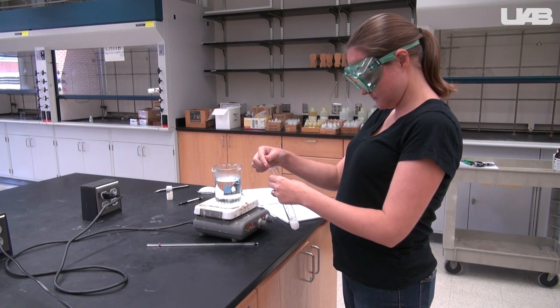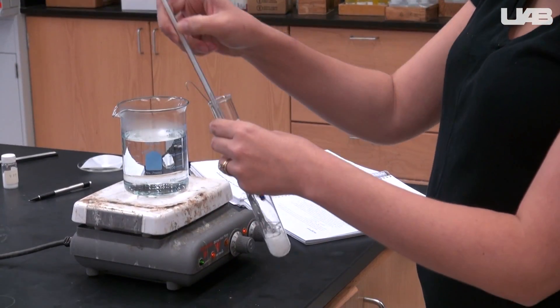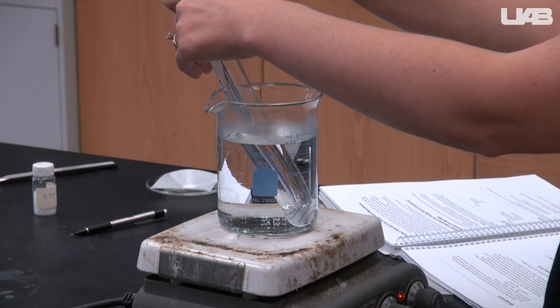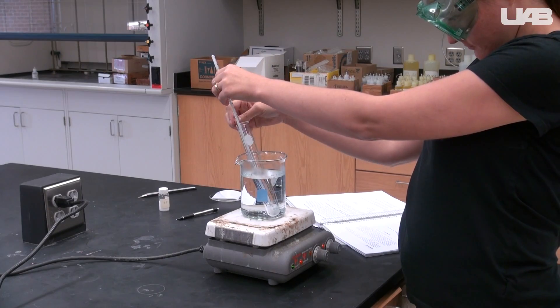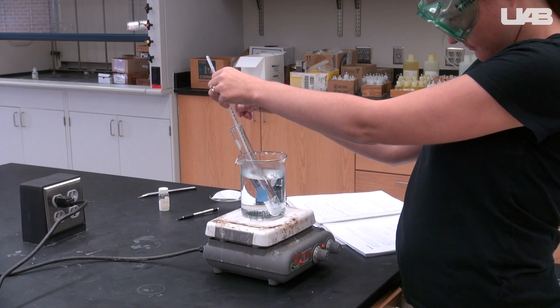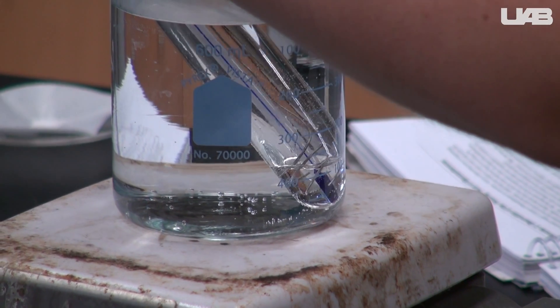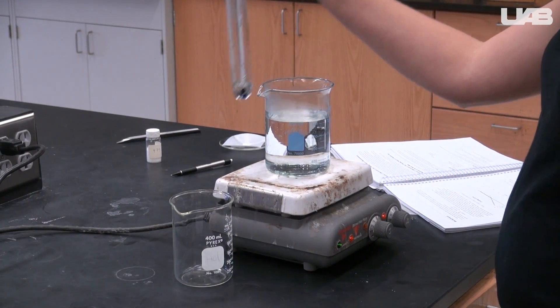Use the weighing paper to transfer the benzophenone to a test tube. Place a thermometer and a wire stirrer inside the test tube and then place the test tube in your hot water bath. Watch the contents of the test tube — the crystals will begin to melt as the temperature rises. You can use the wire stirrer to help mix everything up so that it melts completely. Once the solvent is clear and colorless and you cannot see any remaining crystals, remove it from the hot water bath and place it in an empty beaker.